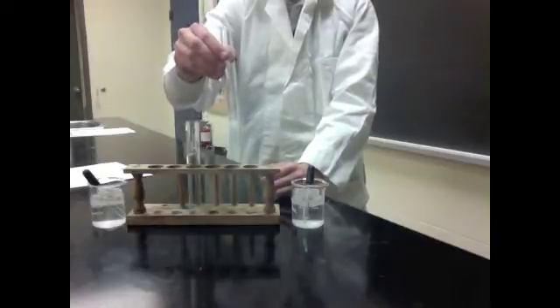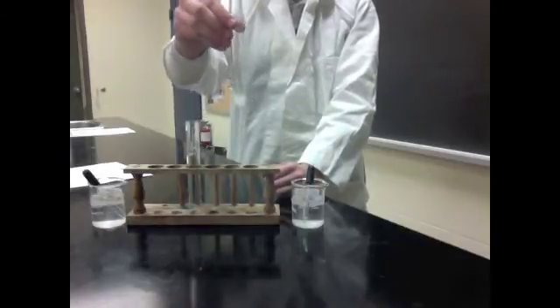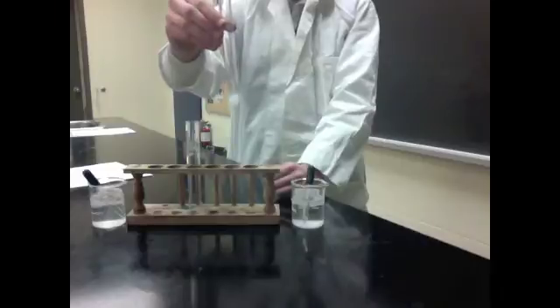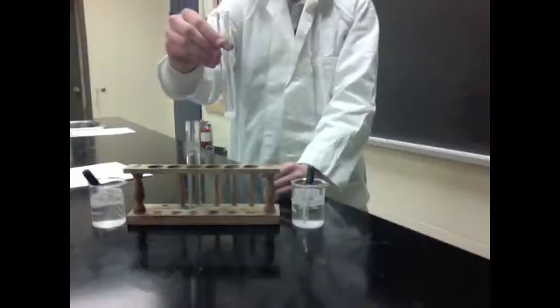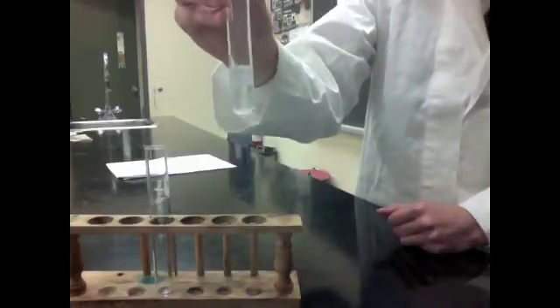I'm just going to stir this a bit. Some time has passed since we've added both aqueous solutions into the test tube. Notice what is formed.